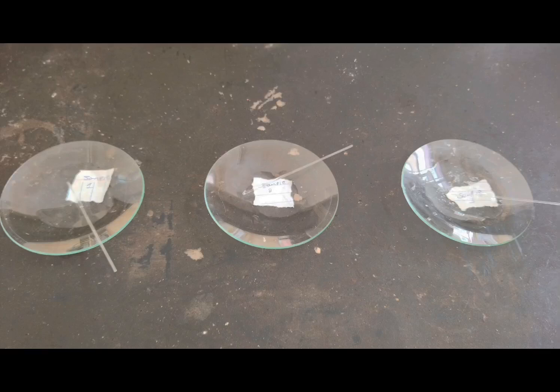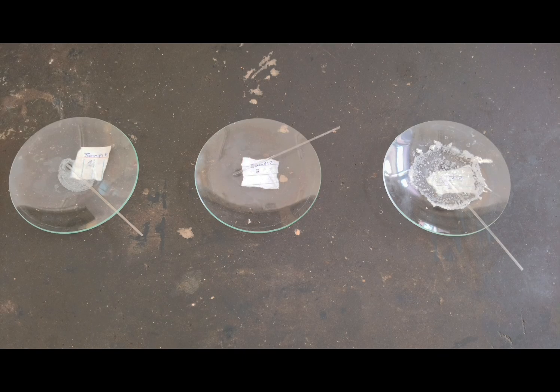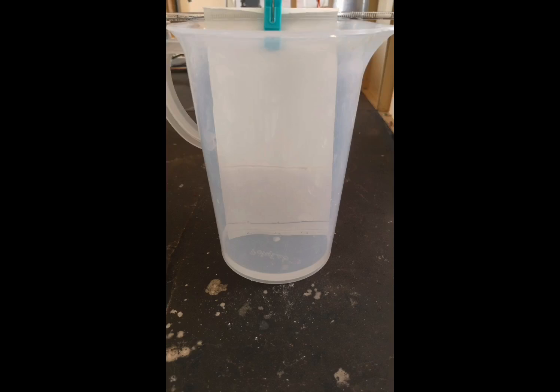So these are the 3 different samples we have taken by means of watch glass. Capillary tubes are used for both the experiments to get the spots. So now this is the thin layer chromatography setup with the tub, taken 150 ml of mobile phase, and it is kept immersed into the bottle, and this is the jar with the paper chromatography immersed inside with the mobile phase. So they have done the experiment like this.